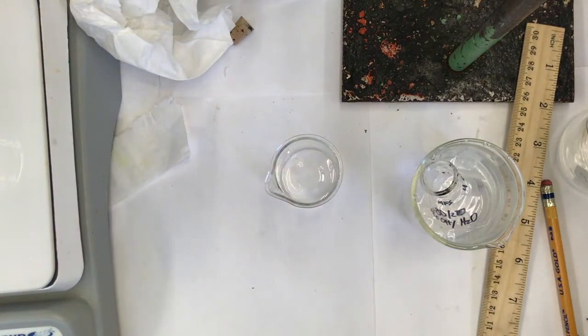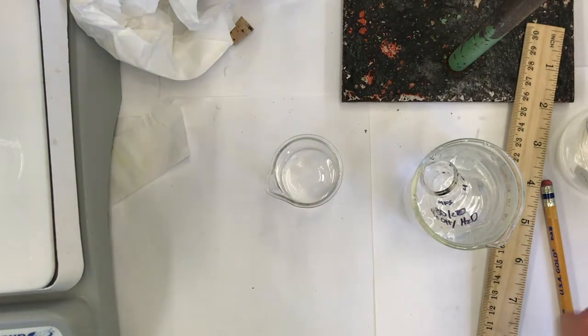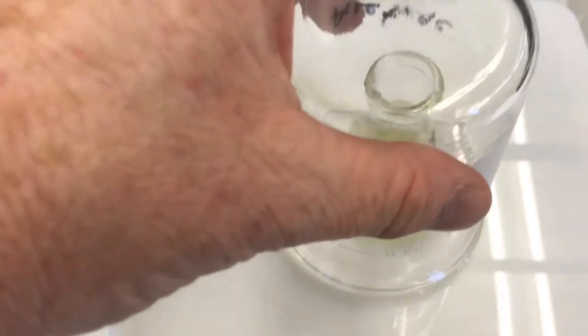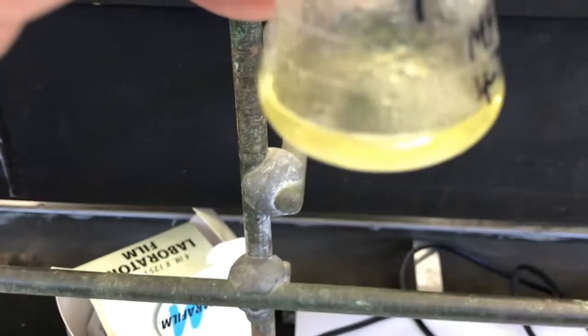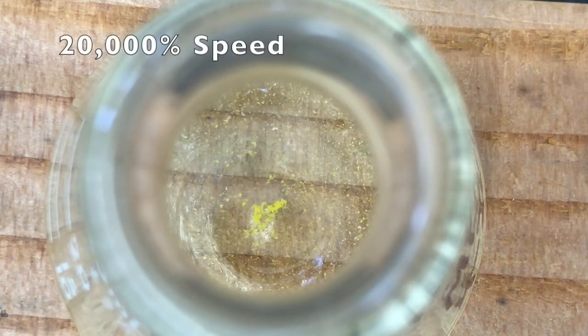So when I'm vacuum filtering, I'll have cold 80-20 methanol water to transfer my crystals and to wash the mother liquor off of them. I still don't have any crystals yet. I'm getting a little impatient, so I'll take off the beaker and remove this, which is still kind of warm. I'm going to let it cool a little faster on a wood block. We'll see how that goes. Oh yeah, I'll set up the cool time-lapse video.